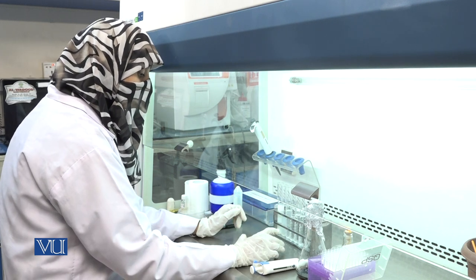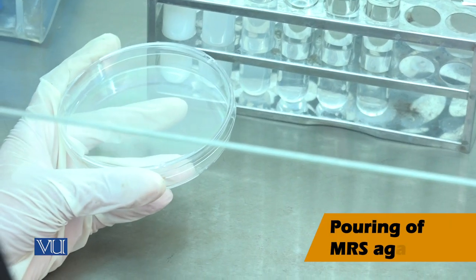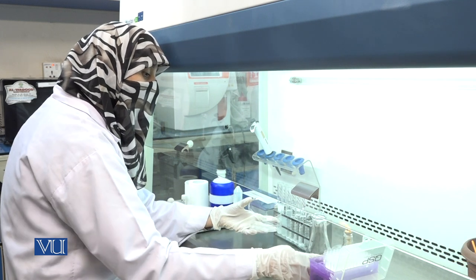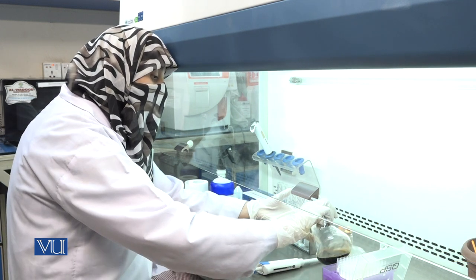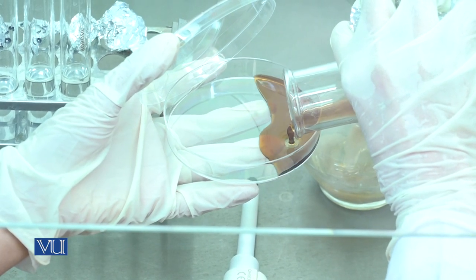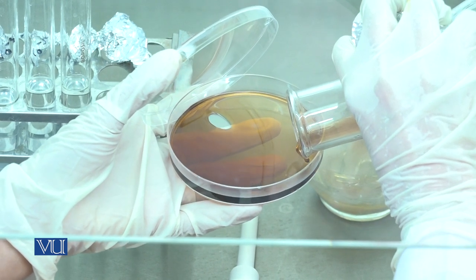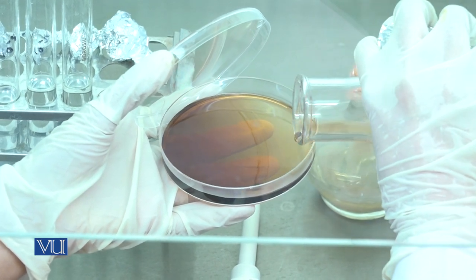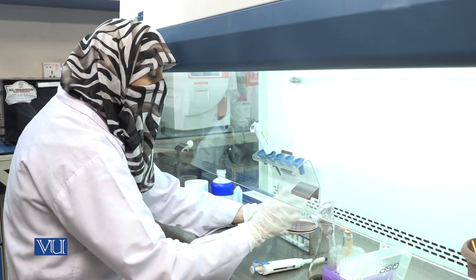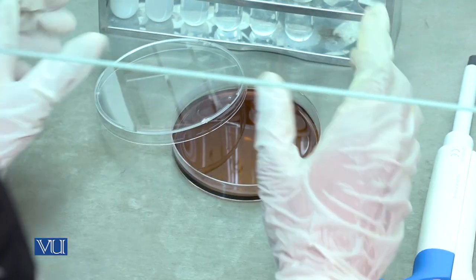After the preparation of serial dilutions, pour MRS agar onto the sterile petri plate. Slowly pour the melted agar into the empty plate. The agar should be evenly distributed throughout the plate. Now place the plate to dry.